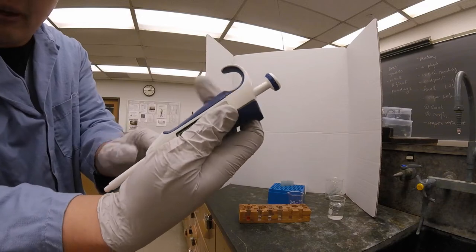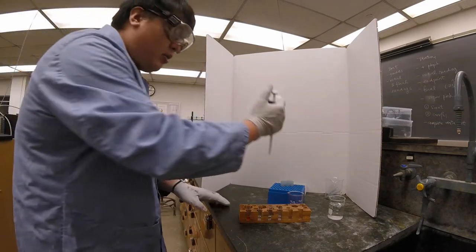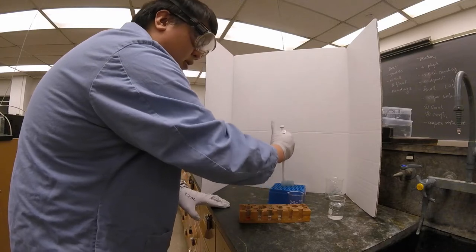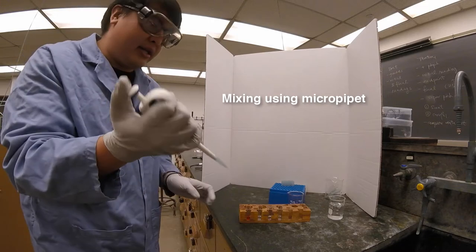I'm not going to change the settings with the micropipette so it still reads a thousand. And we're just going to do the exact same thing, but we're going to include a mixing step this time and I'll show you that in this video.